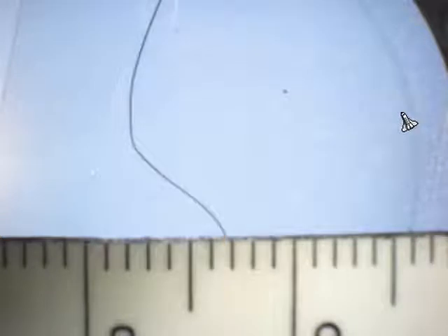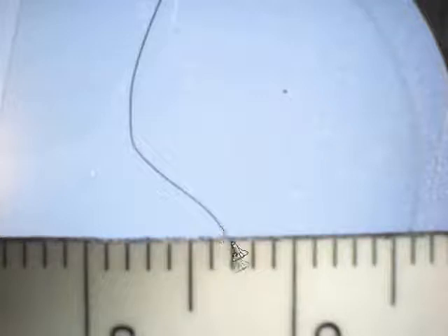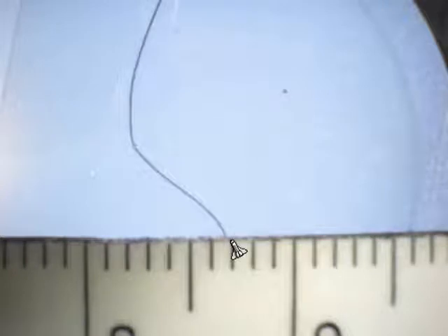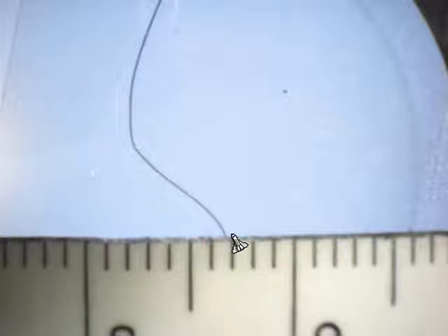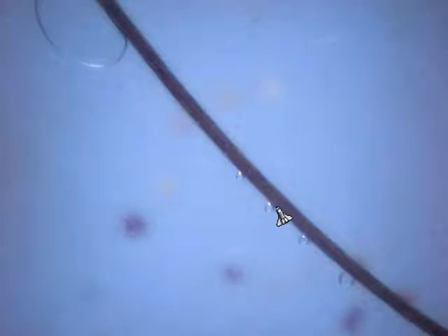Here we are looking at a hair under the microscope. I've put a ruler down so you can get the dimensions. There's my hair, there's the ruler, and each little division is one millimeter. I could probably put about ten hairs side by side, giving an average hair width of about 0.1 millimeters, which is pretty close to the accepted average. At sixty times power you can see my hair again. The air bubbles here are not cells — students commonly think those are cells, but whenever you see a perfectly circular, highly reflective structure, it's going to be an air bubble.